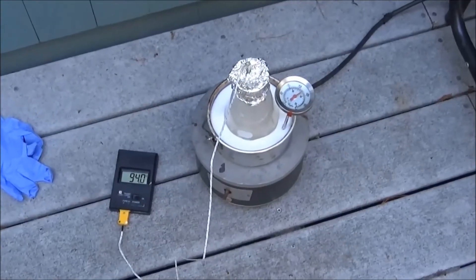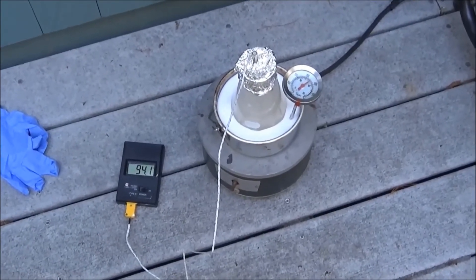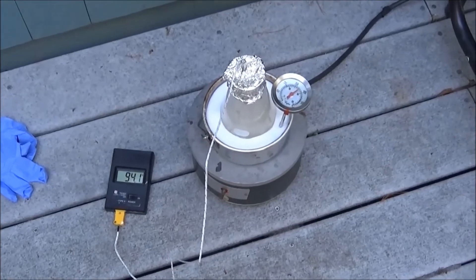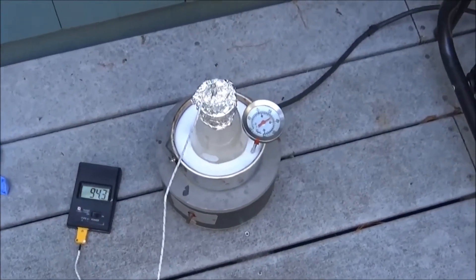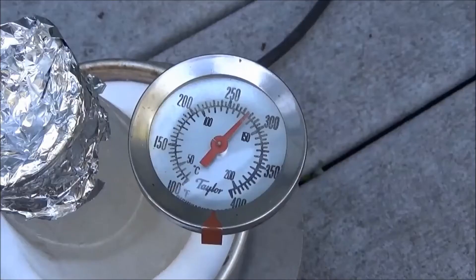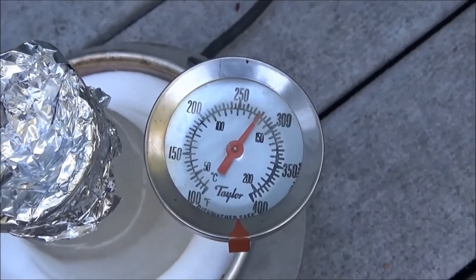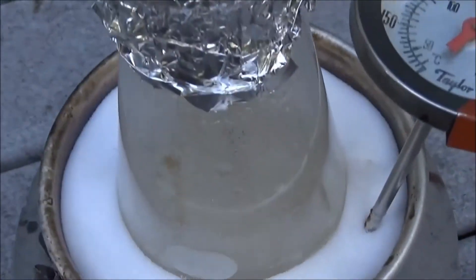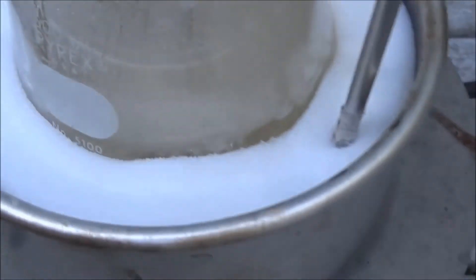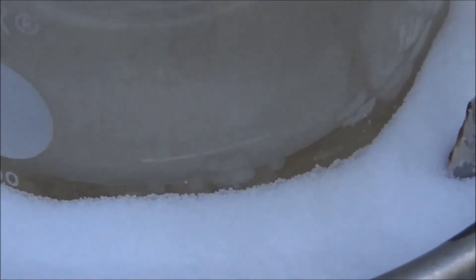The flask was placed in a salt bath on top of a hot plate. I put a thermometer in the middle of the mixture and covered the top with tinfoil. The thermometer allows me to take the temperature of the melt. Everything melted into a clear liquid around 130 degrees with evolution of gas.